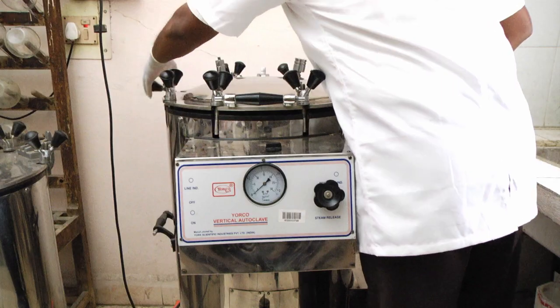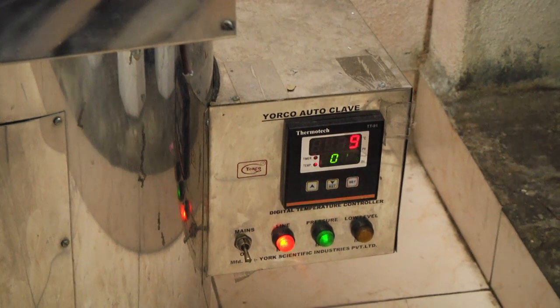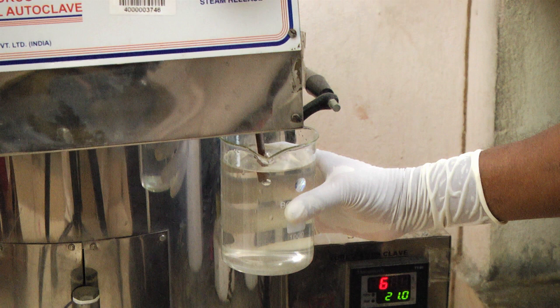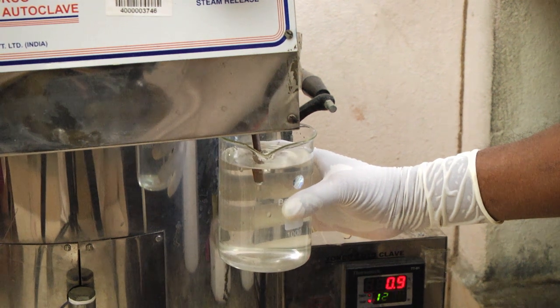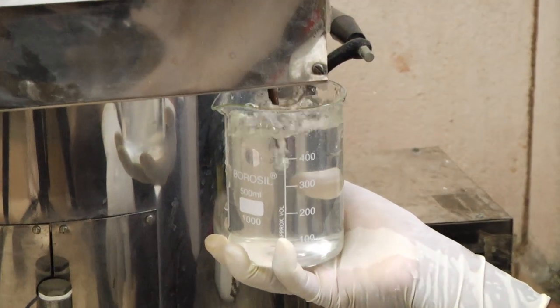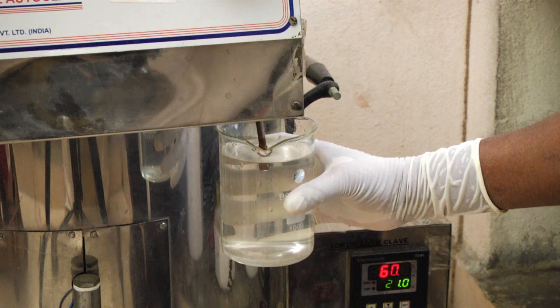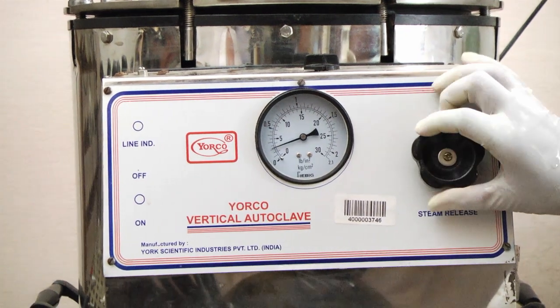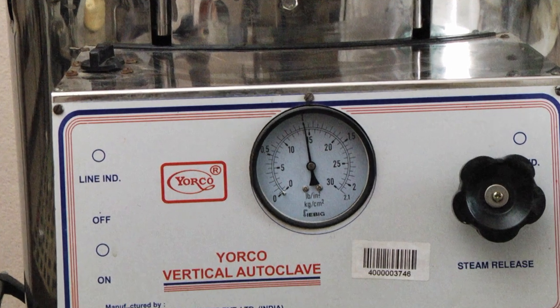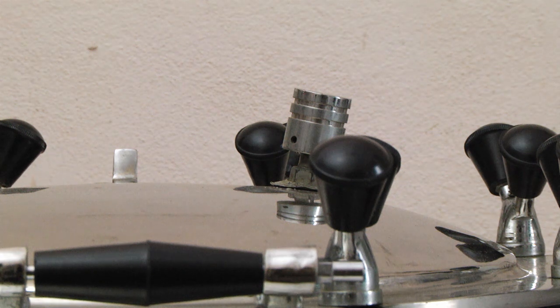Secure the lid of the autoclave as instructed by the manufacturer. Open the air cock and close the draw-off cock, then heat the autoclave — if electric, switch to maximum setting. Allow the correct length of time for all air to be expelled. To check if all air has been expelled, connect one end of tubing to the air outlet and immerse the other end in a container of water; all air has been expelled when no more bubbles emerge. Close the air cock to cause pressure and temperature to rise. When the required pressure is reached and excess steam begins to be released from the safety valve, reduce the heat and begin timing.